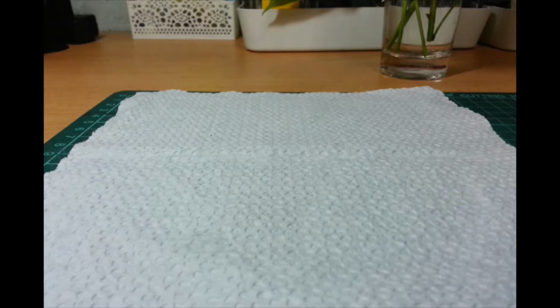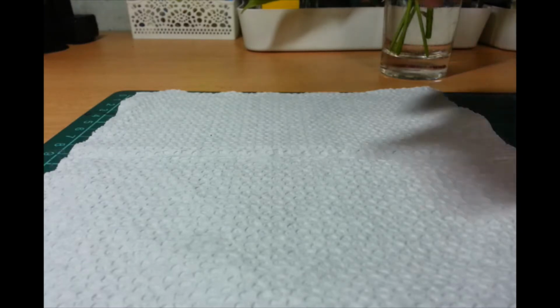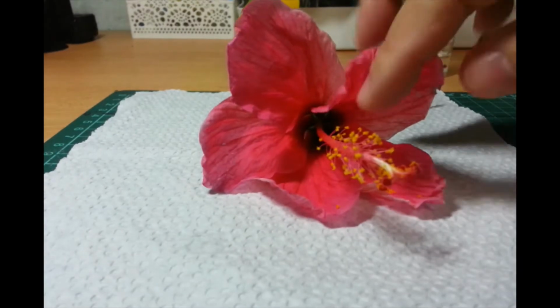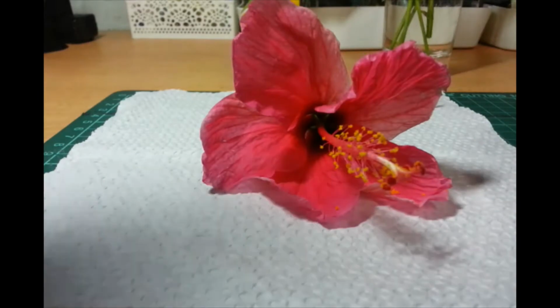Oops, you already see a flower. Well, you see the pollinators scurrying around. Actually, the flower is already wilting. So, I'll start. It took me a while, and we asked for this from, well, not a neighbor, but someone nearby. Around our subdivision, we found this Gumamela plant with many flowers. So, we asked for some earlier.